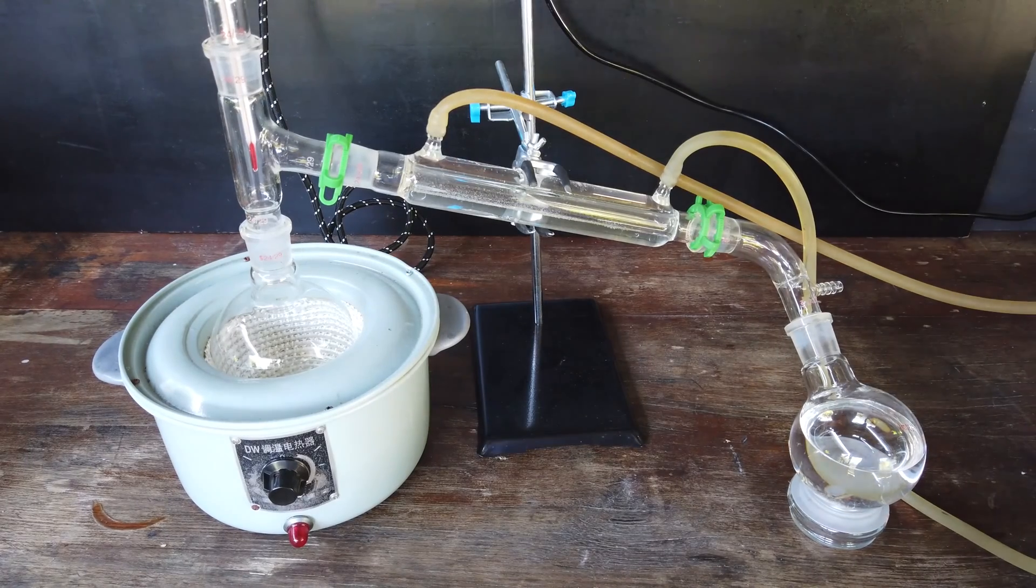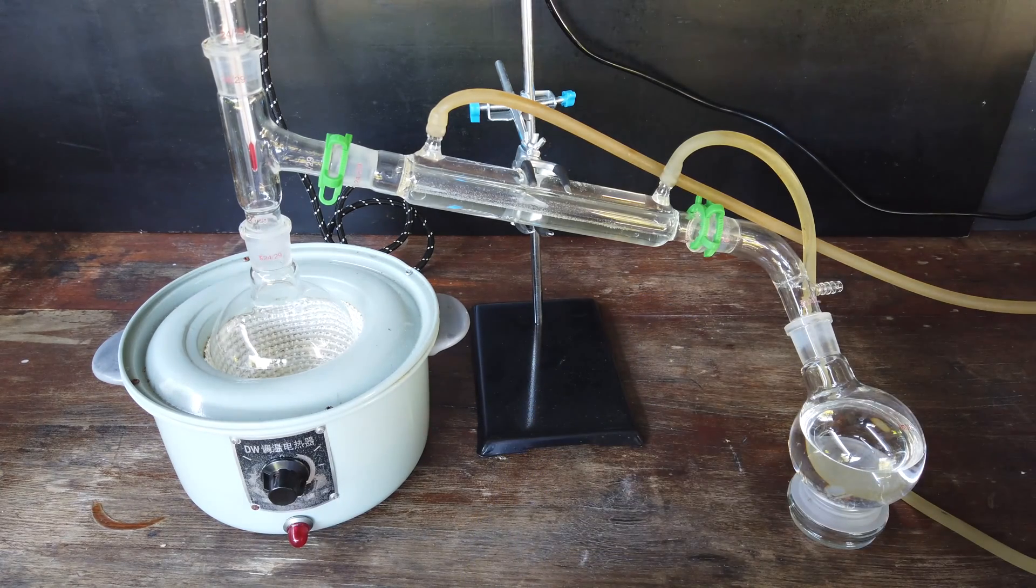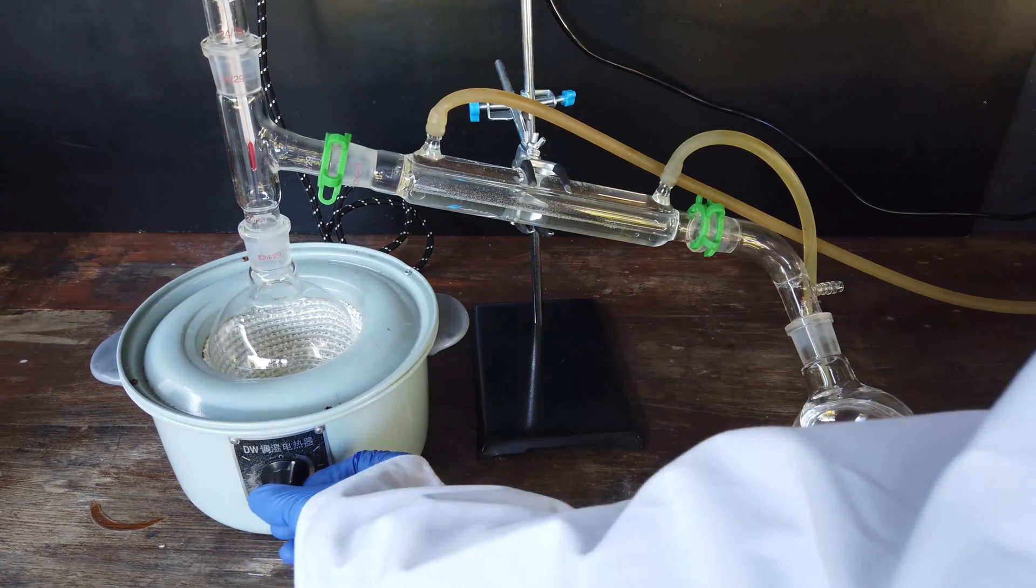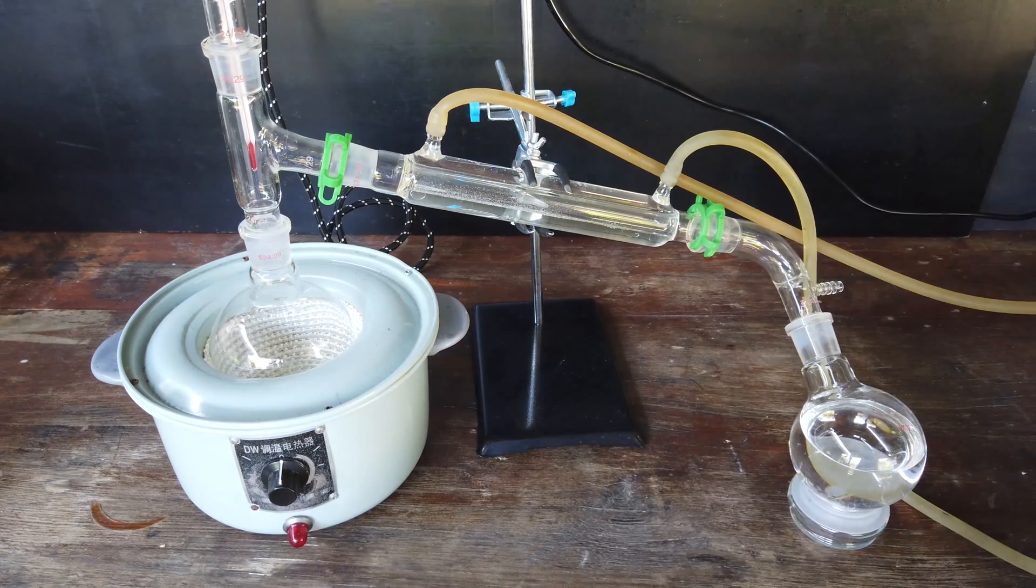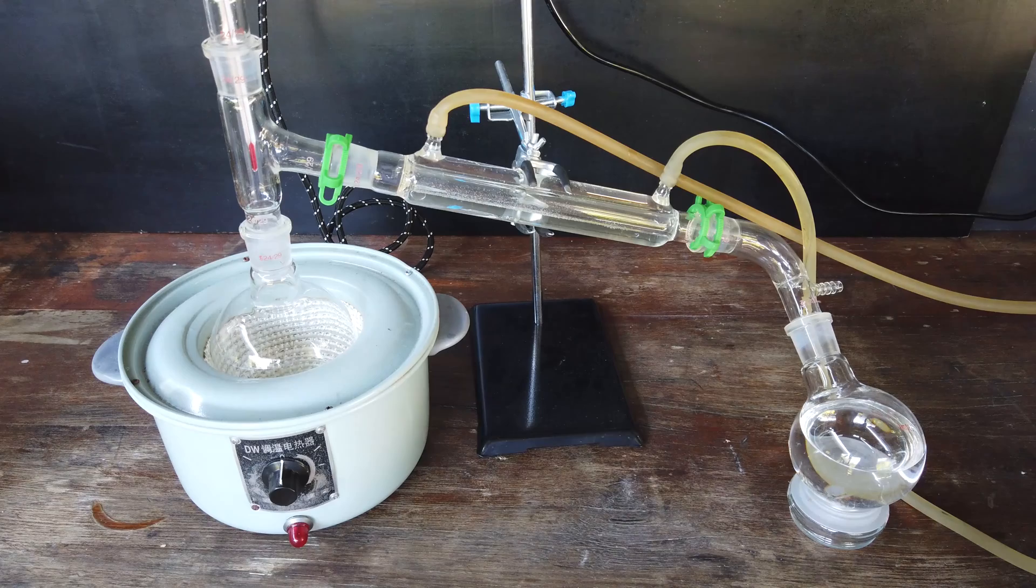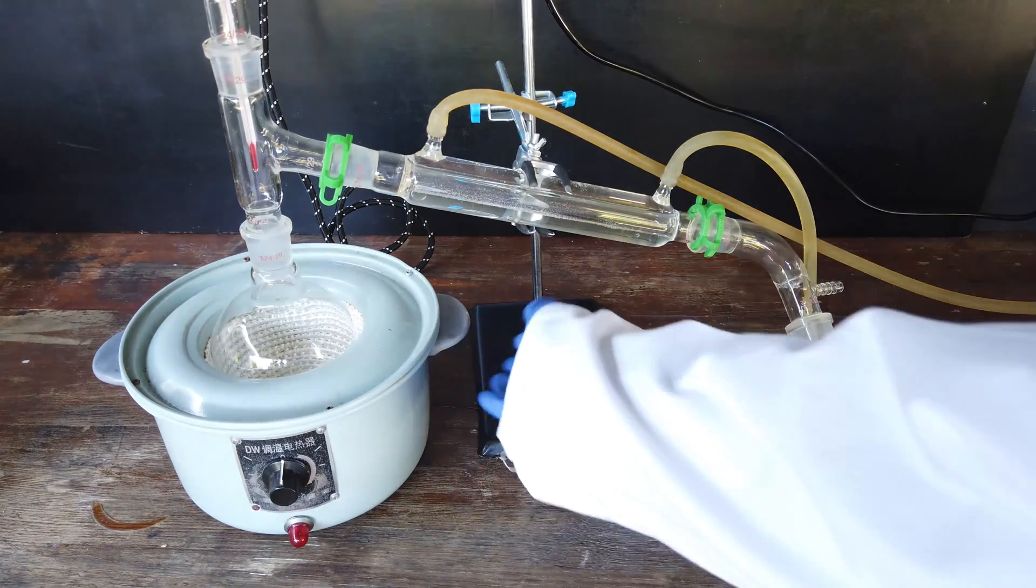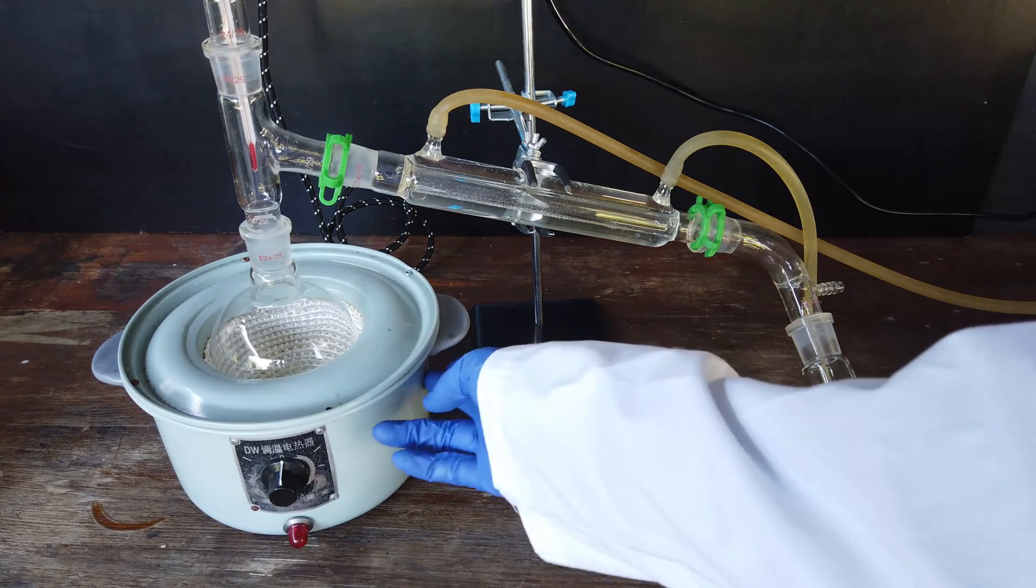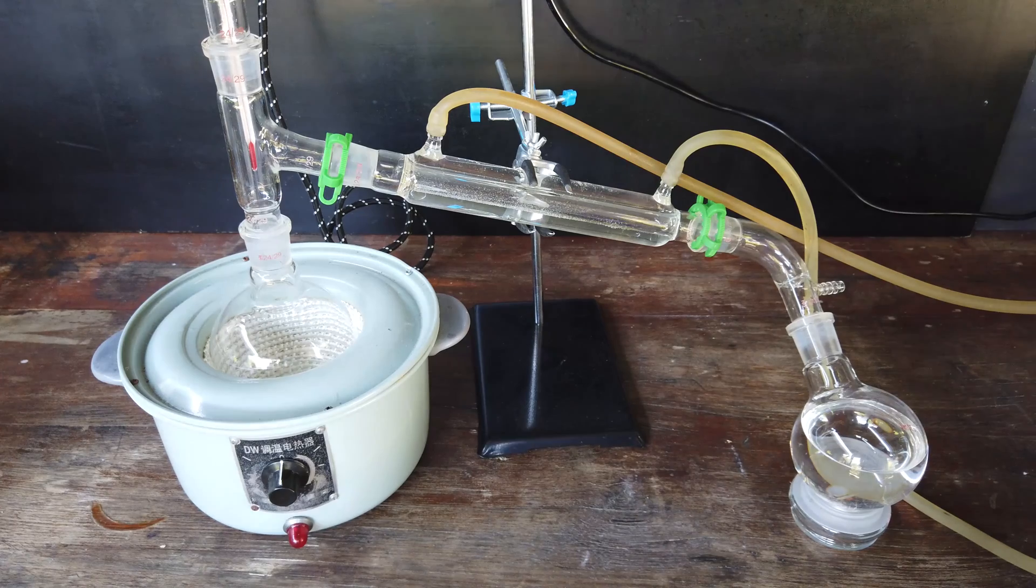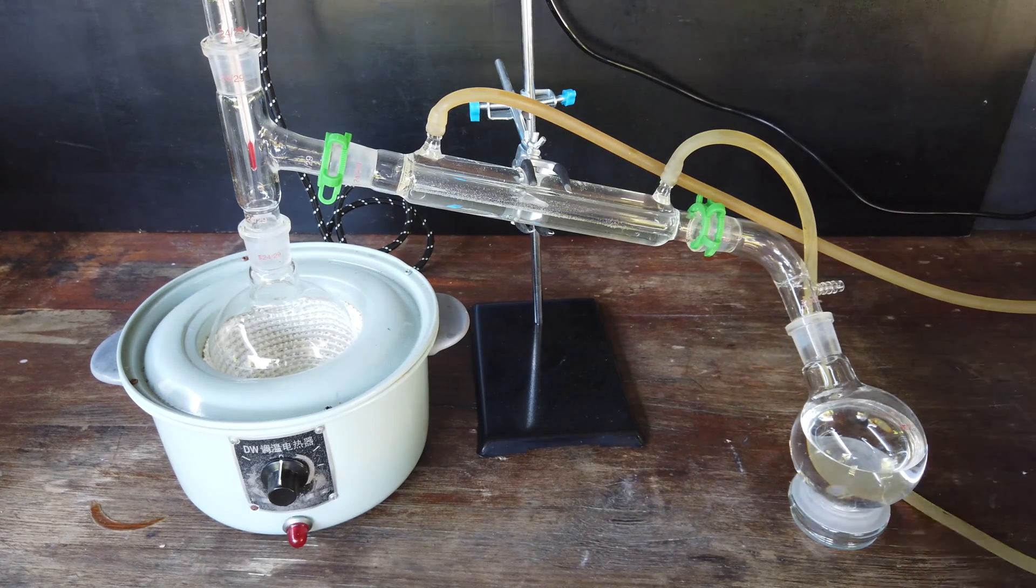Disaster strikes a little bit. Sadly, coming to the end of our distillation here, the heating mantle has completely stopped working. I knew this was going to happen at some point soon because the element has actually broken in the past, and I've had to go in there and reconnect things multiple times. I think this is about the point where I'm just going to say I'm done with this heating mantle. I have ordered another one, but it's not here yet. That means this distillation has been stopped short.